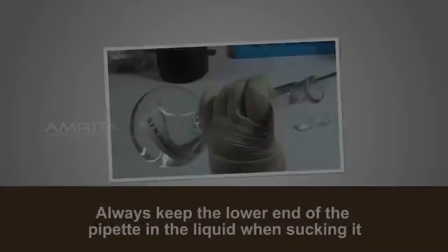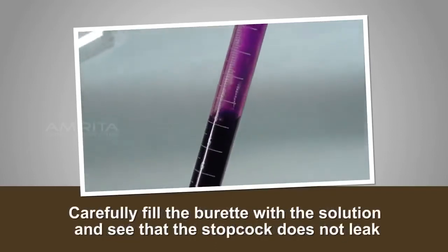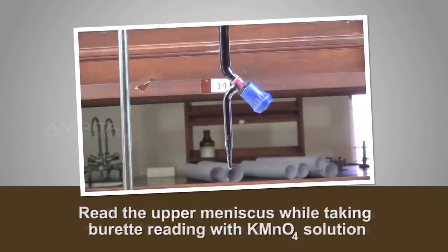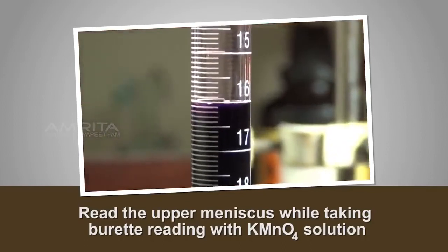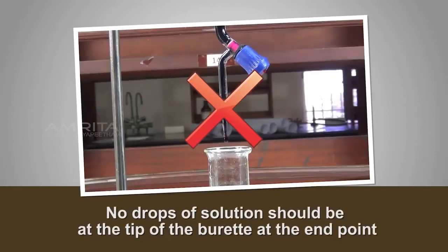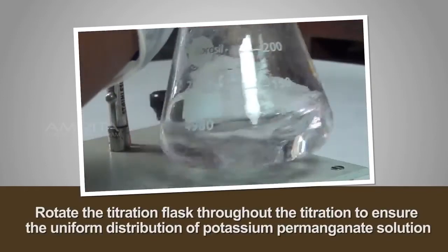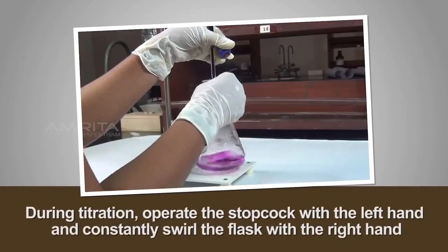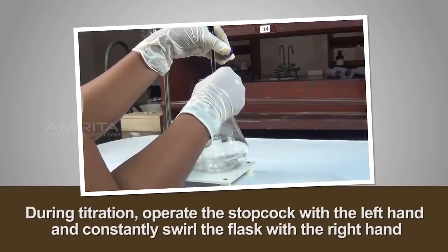Precautions. Always keep the lower end of the pipette in the liquid when sucking it. Carefully fill the burette with the solution and see that the stopcock does not leak. Read the upper meniscus while taking burette reading with potassium permanganate solution. No drops of solution should be at the tip of the burette at the end point. Rotate the titration flask throughout the titration to ensure the uniform distribution of potassium permanganate solution. During titration, operate the stopcock with the left hand and constantly swirl the flask with the right.